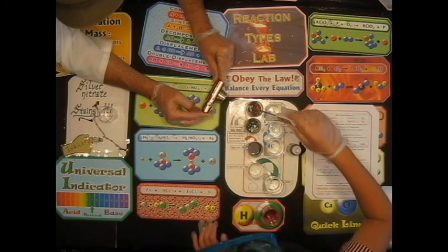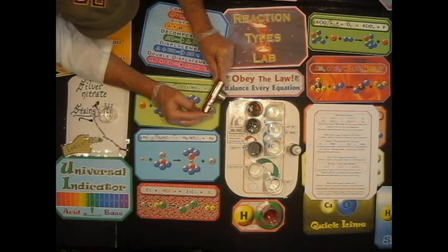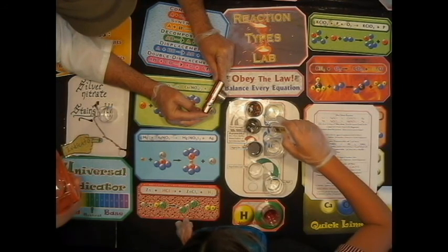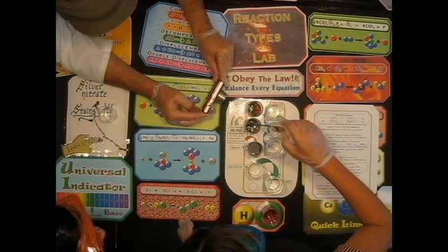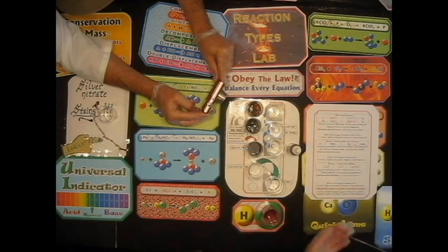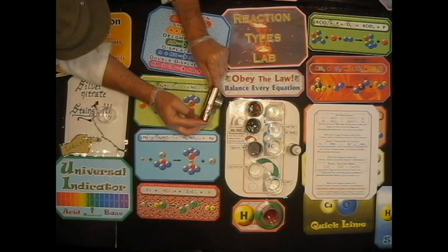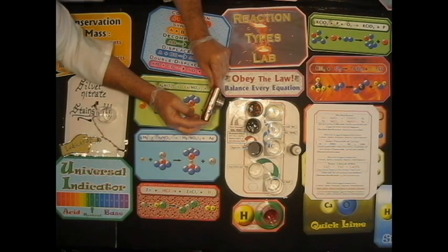So a very small, if any, change in temperature. Now wipe it off and then put it in the other one. Okay, so there is a change in temperature. For some slow chemical reactions, you might not get a real dramatic bubbling or anything. But I do see signs of chemical reaction. What's the biggest sign that something is happening here?